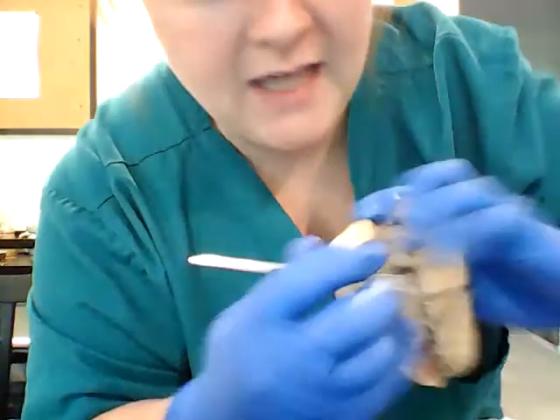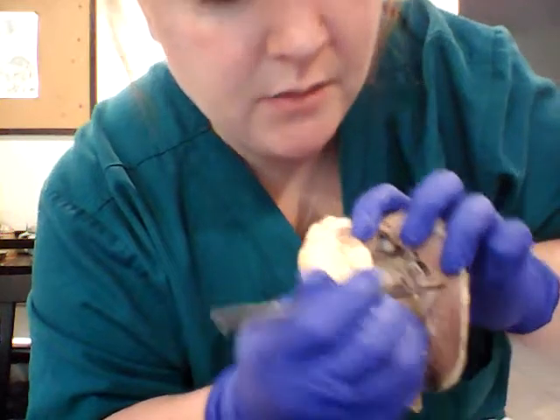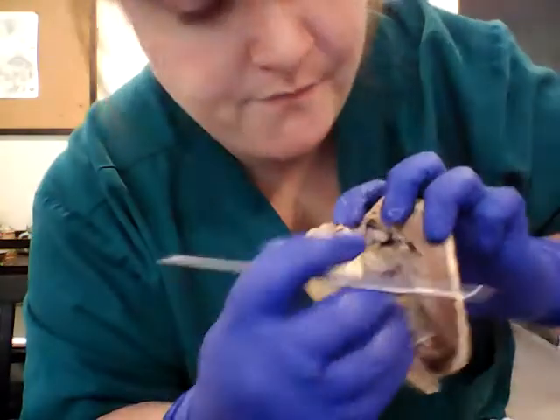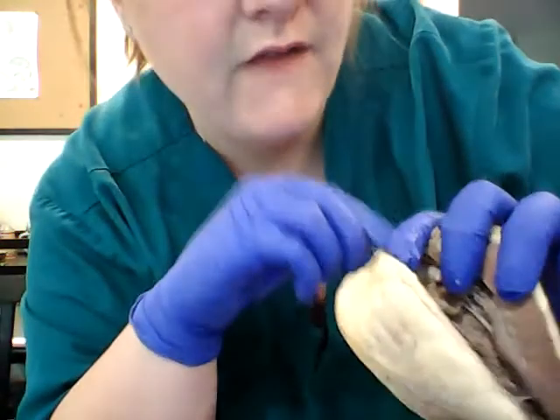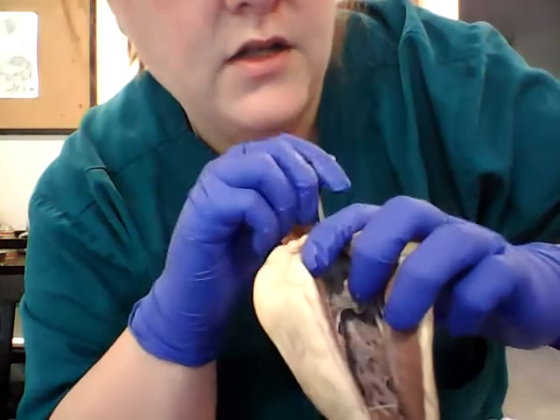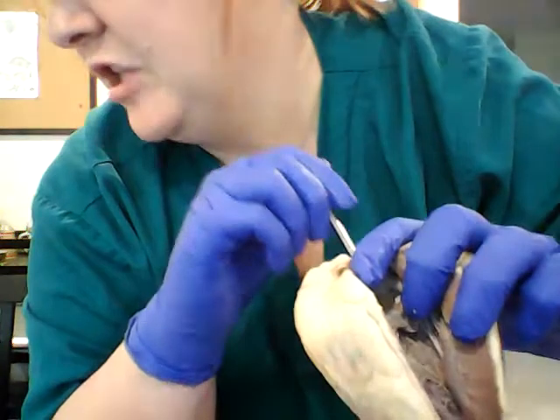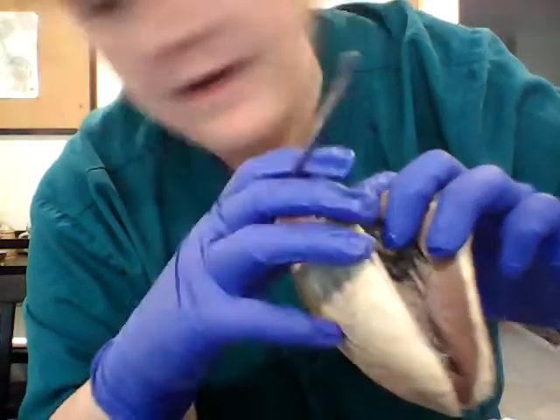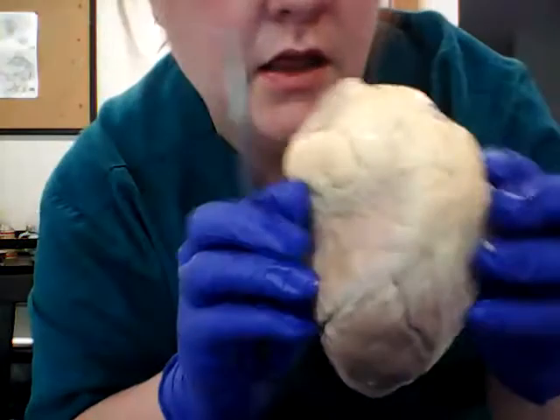We have the muscle again. We have the epicardium. It's much easier to see the myocardium in this because it's a big, big chunk. And then we have our endocardium here. And then right here, this section here, we have our aortic valve, just past the mitral valve right here. It's much, much easier to see. And that is everything. So we'll get a good, nice look at that. There we go.